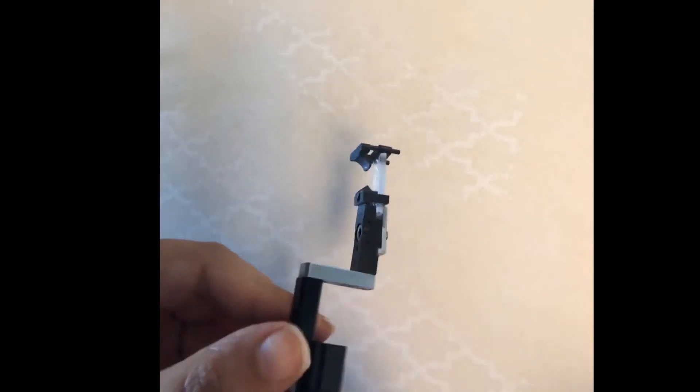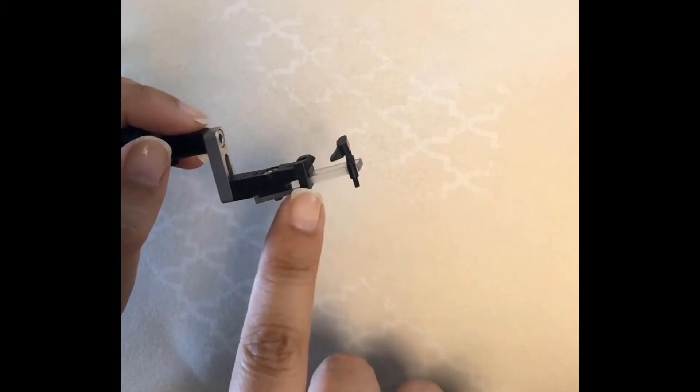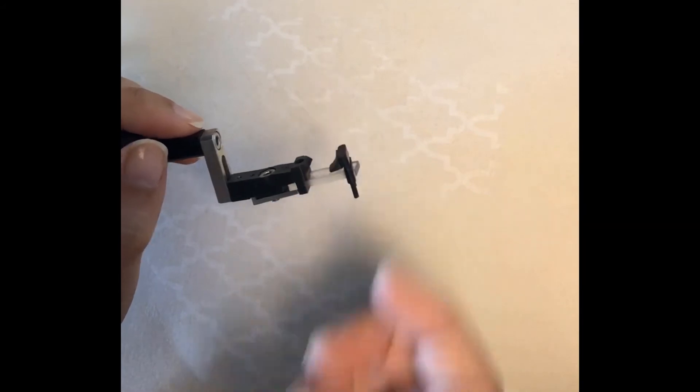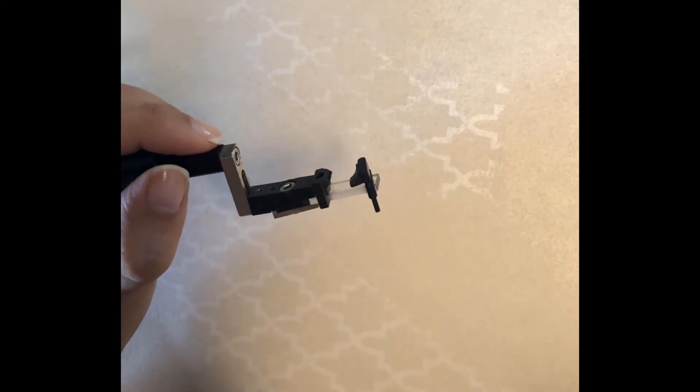This pincher makes closer contact with the glass support when pressed down and is better for holding thinner samples like zebrafish tadpole tails or tissue slices. This other pincher is better for taller samples, since it grips the sample at the top.